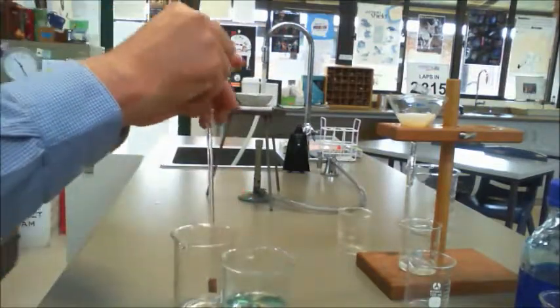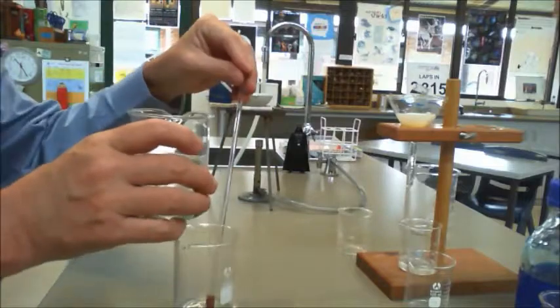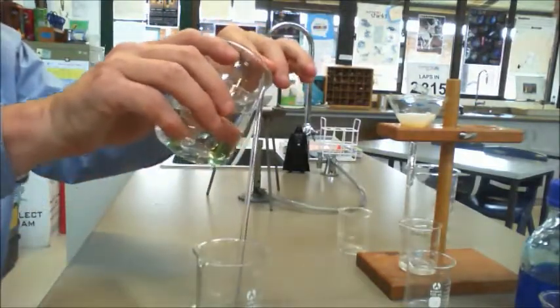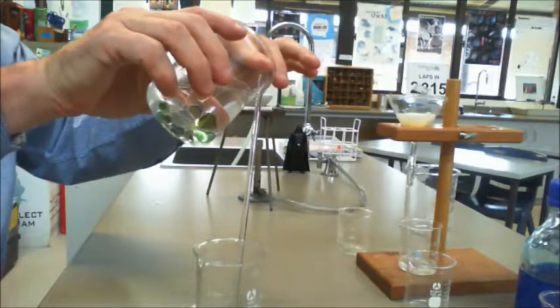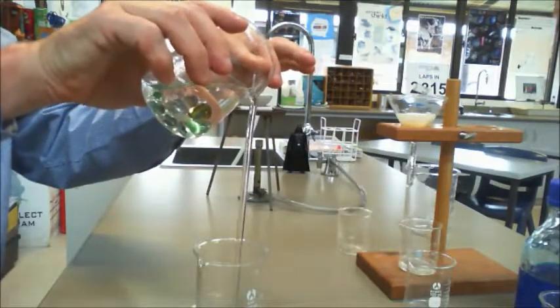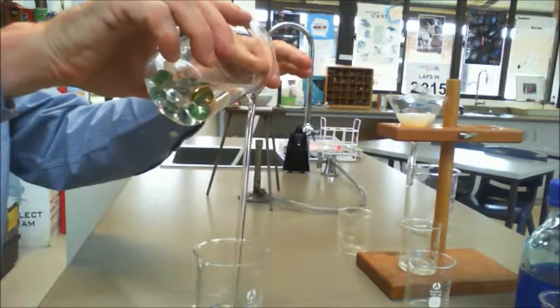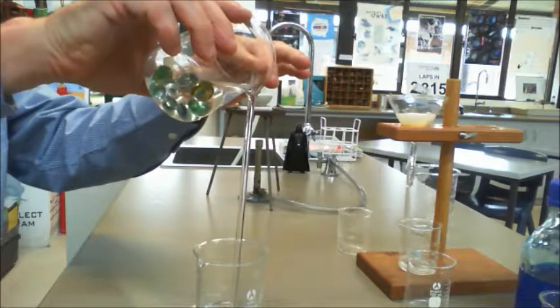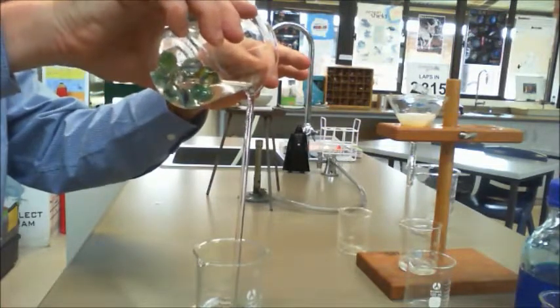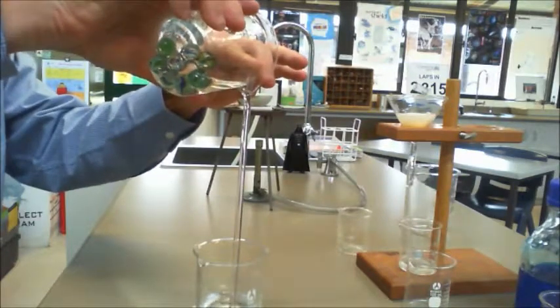So what you can do is place a stirring rod into the other beaker, and then you can pour the liquid down, and what that does is enable the water to be attracted and stick to, in this case, the glass, and it just falls down, and it's quite easier. It also has the advantage, when you've got larger insoluble particles, of helping to catch them and stop them from dropping in.